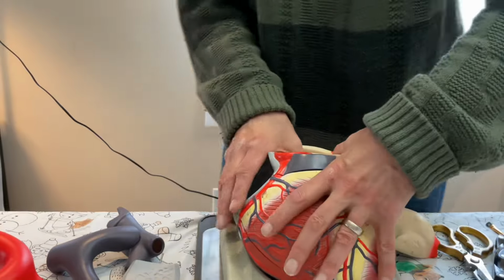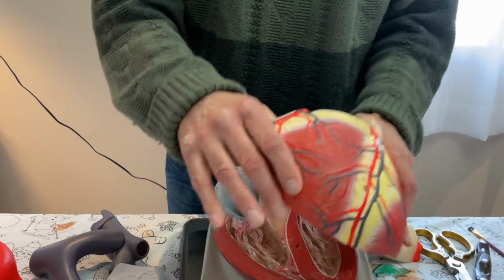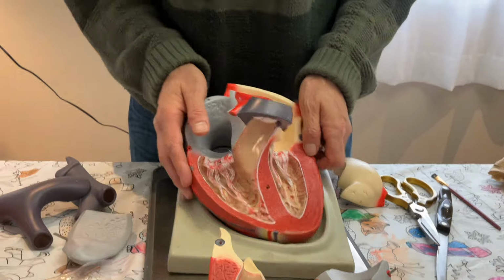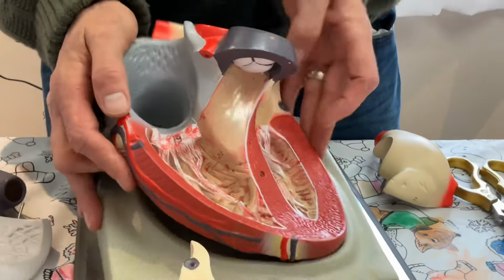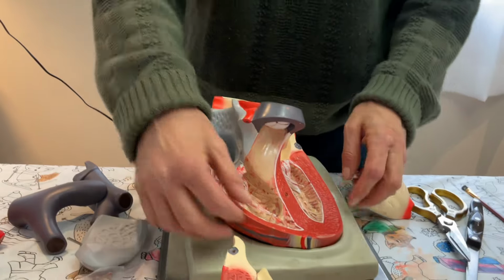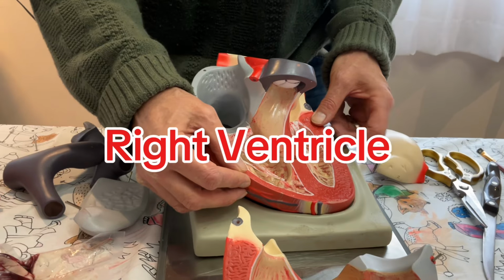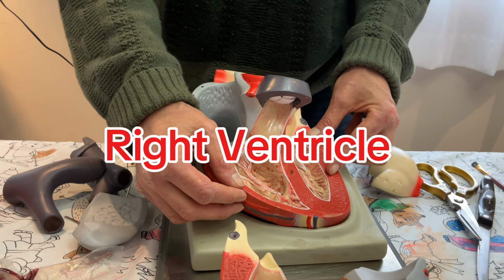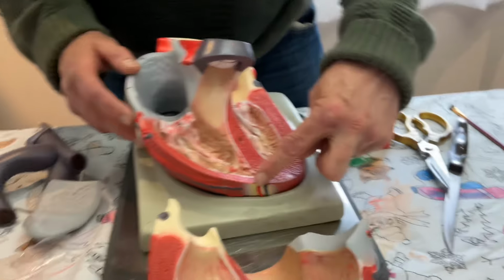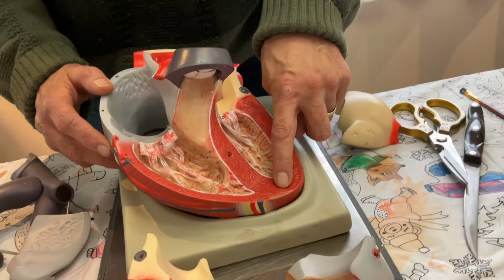I'm going to pull this off, and I'm going to reveal the inside of the heart. And what do we see? We see a couple of things. And we have 2 more muscly chambers on the right side and the left side. This here is called the right ventricle, and this is called the left ventricle. Now notice, before we move on, the muscle on the wall of the right ventricle is thinner than the muscle on the wall of the left ventricle.